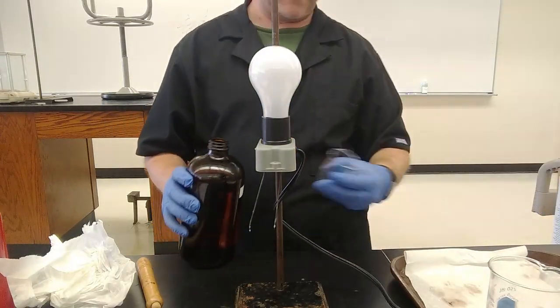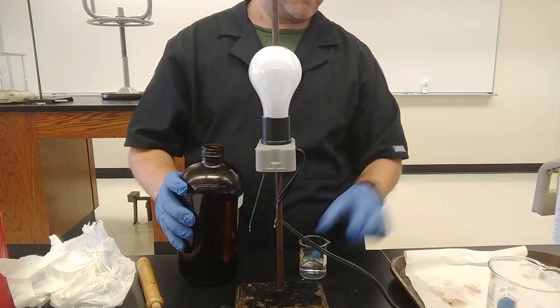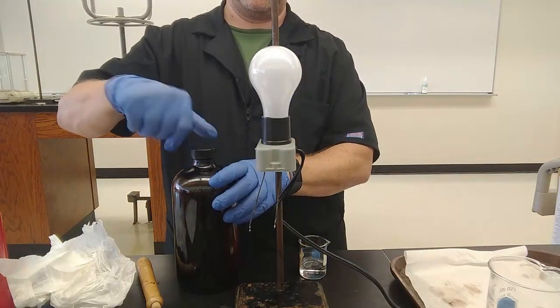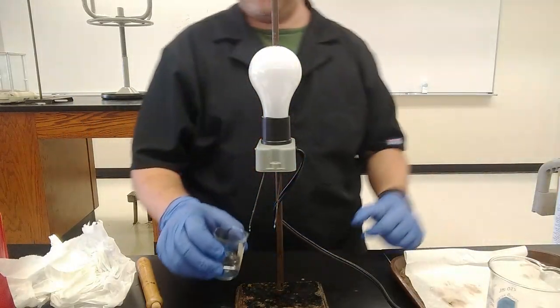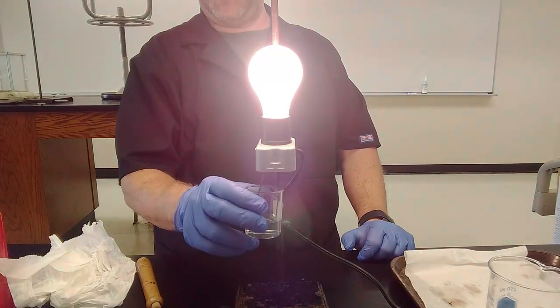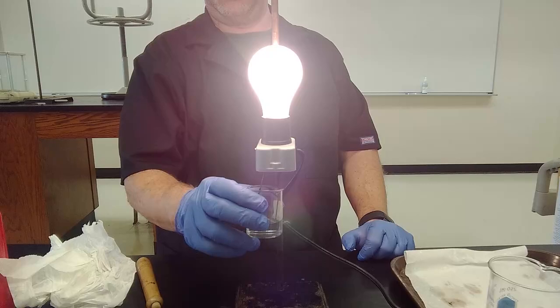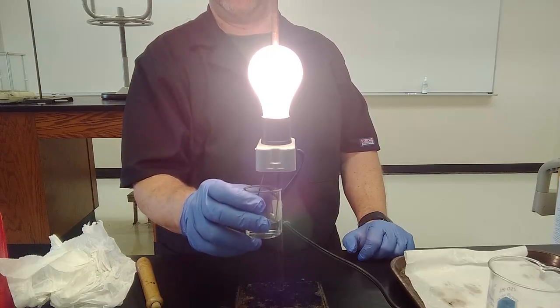Let's see what that looks like. Again, equal to just conducting it with a piece of metal.